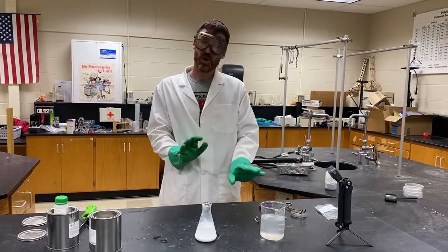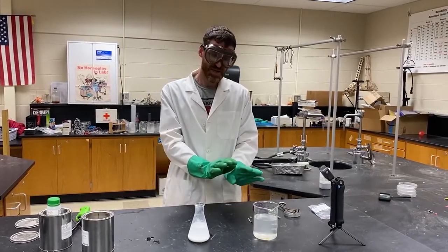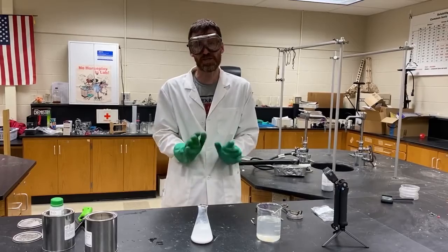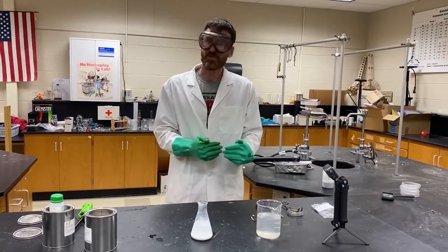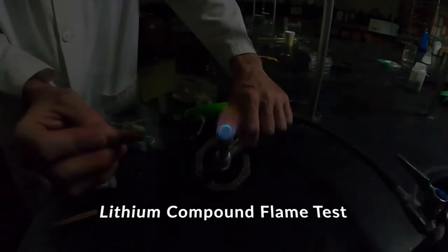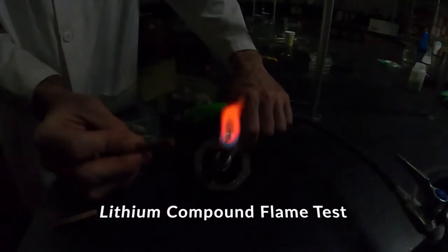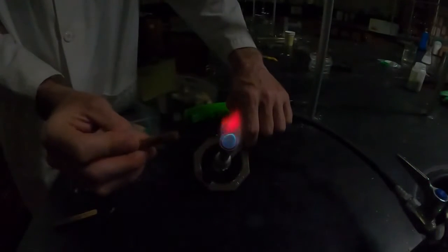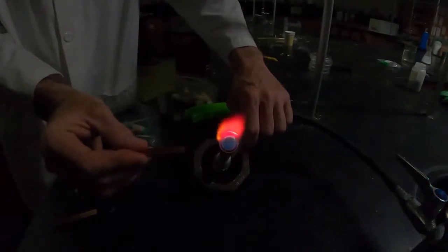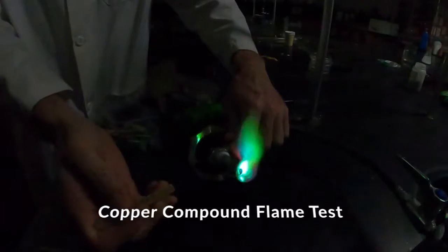And I wanted you to also pay attention to the orange flame that it was. That's a telltale sign of the metal that is burning. There is something called a flame test, in which different metals will burn at different colors. And it's why we get fireworks of brilliant different colors. We have different metals in there. And what we can do here is we can identify the element from the color of it.